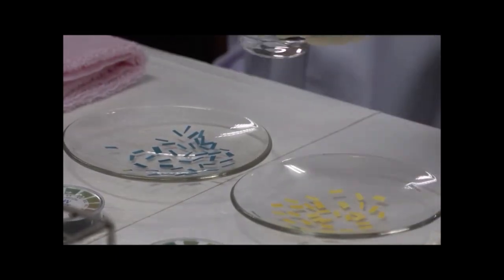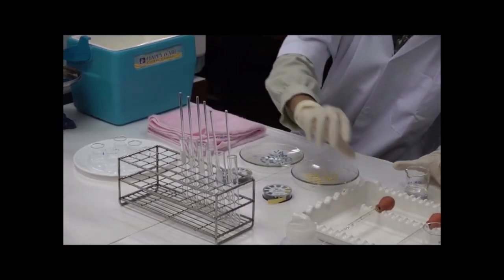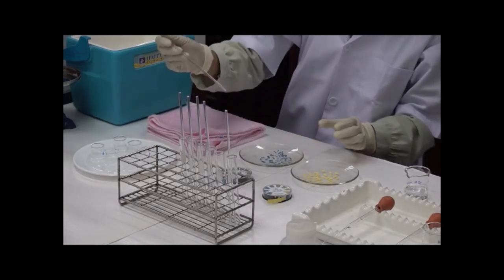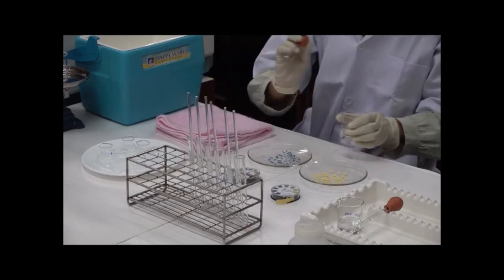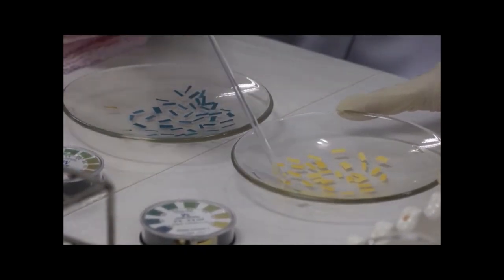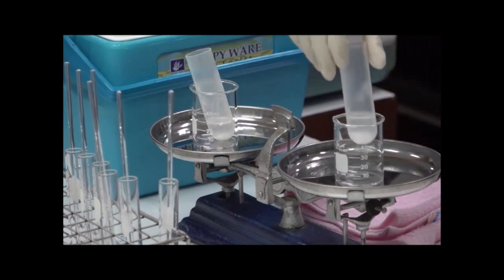Neutralize with 10 normal potassium hydroxide until reaching pH 3, and test with Thymol Blue test paper. After that, neutralize with 1 normal potassium hydroxide until reaching pH 6.5 to 6.8, testing with Bromothymol Blue test paper. Balance with non-neutralized PCA.